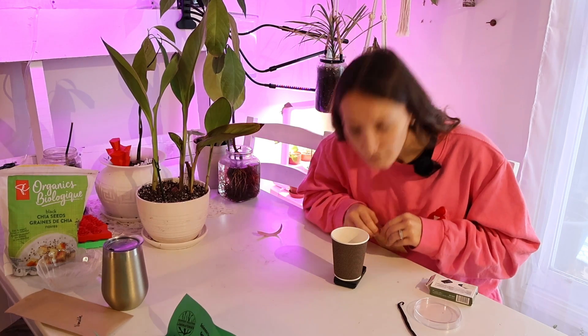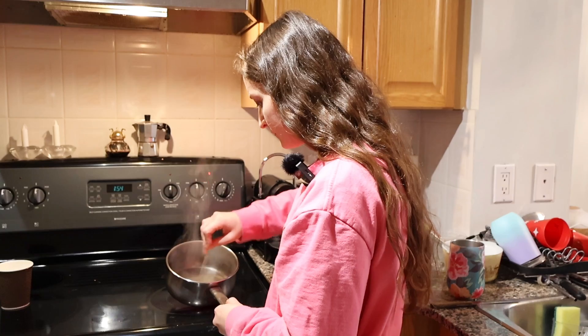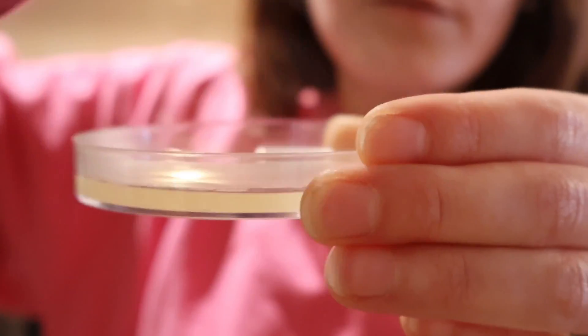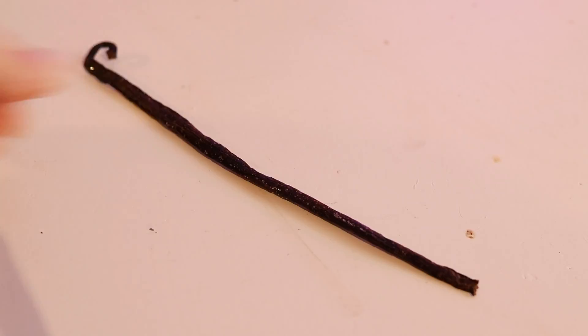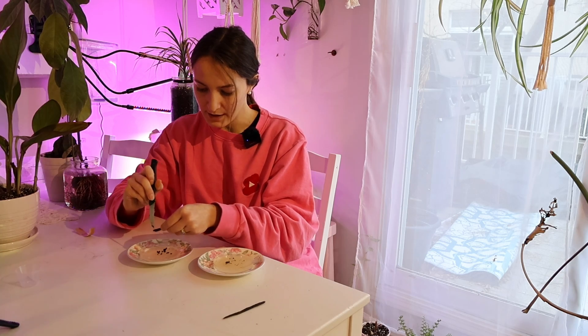I needed to get my hands on something called nutrient agar and get to work. Once my culture medium arrived, I was ready to start our attempt at growing the second most expensive spice in the world after saffron. I got the liquids together, followed all of the instructions, and once the liquids were ready, I pushed the seeds inside of not one but two petri dishes. We always have to make sure we have options just in case we fail, because it's all trial and error.